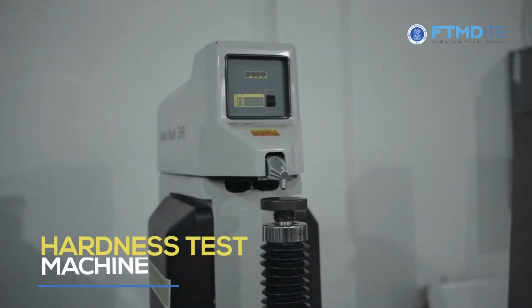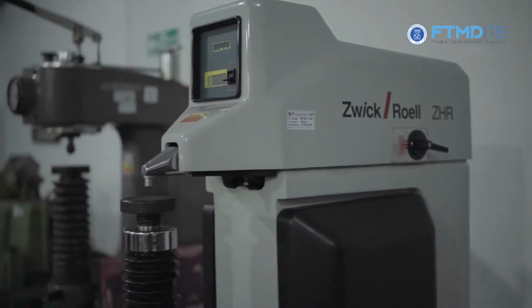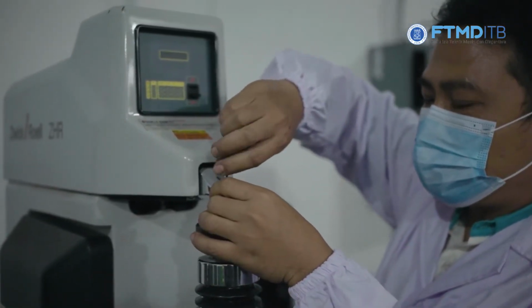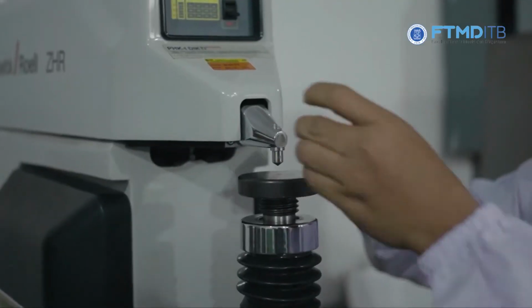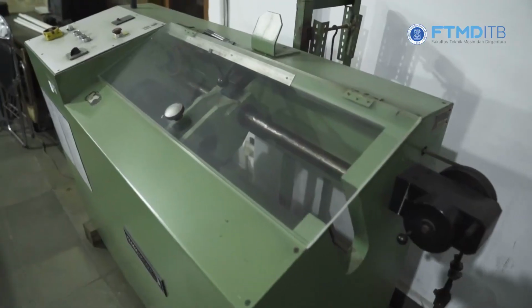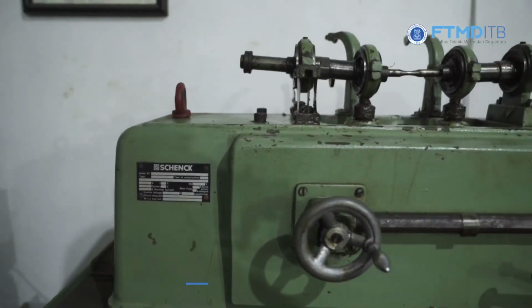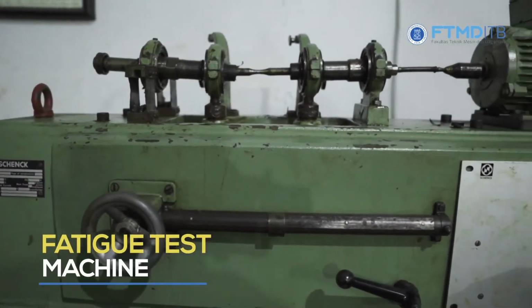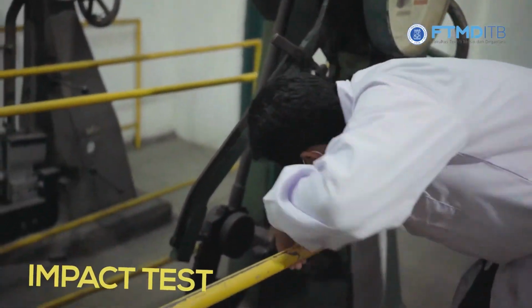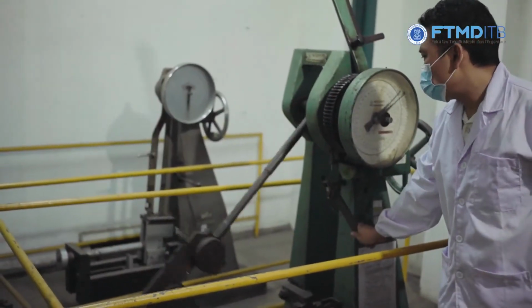Next, we have the hardness test machine. This machine can be used to determine the hardness value of material through several methods such as Brinell or Rockwell hardness test. We also have a micro Vickers hardness test machine with an automatic feature to determine the hardness value of the sample. For torsional testing of materials, we have a torsion testing machine. And for fatigue testing with the rotational bending fatigue test method, we have fatigue test equipment. Last, we have the impact test machine, which tests the toughness of materials by either the Charpy or Izod method.